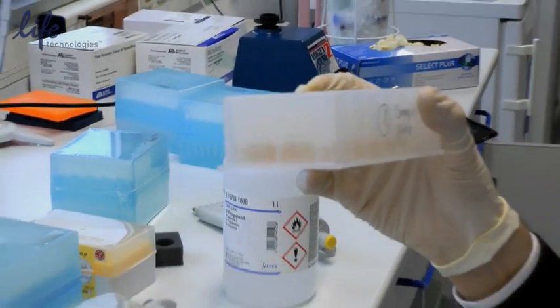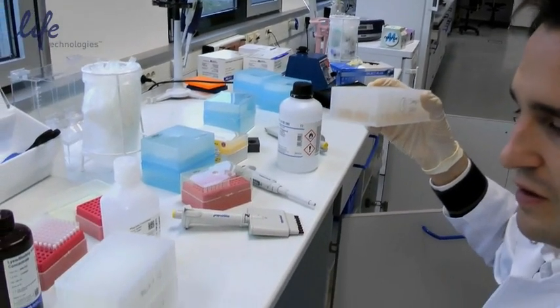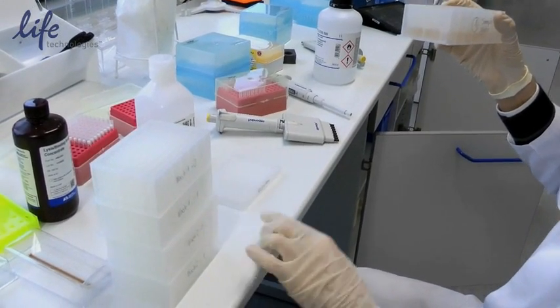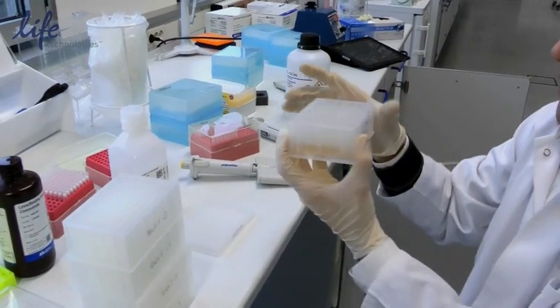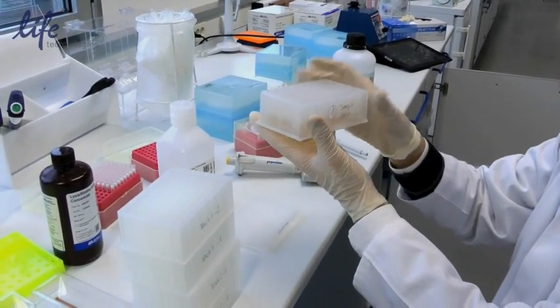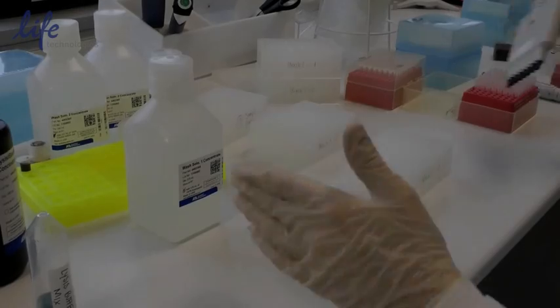The rest of our plates are ready as well, but these will not go into the extraction zone or the blood zone. They'll remain here and will go directly into the instrument. The only plate that we will be taking to the new zone is the one in which we need to add the samples.